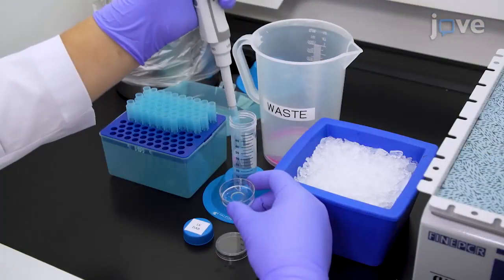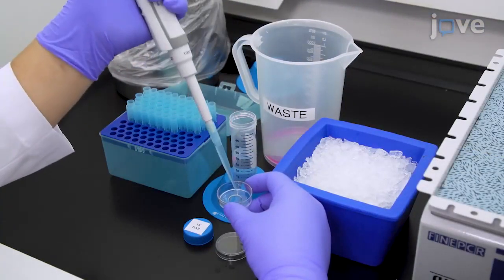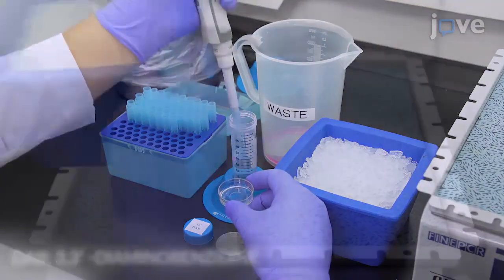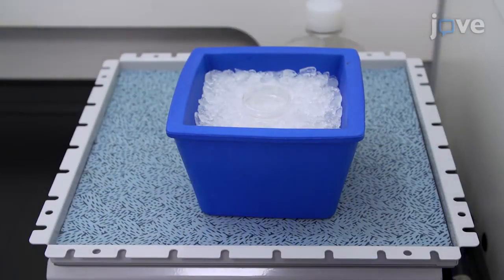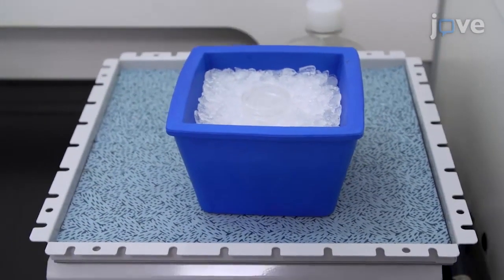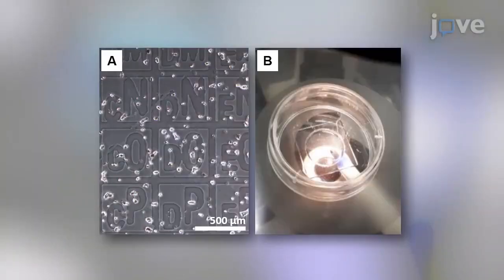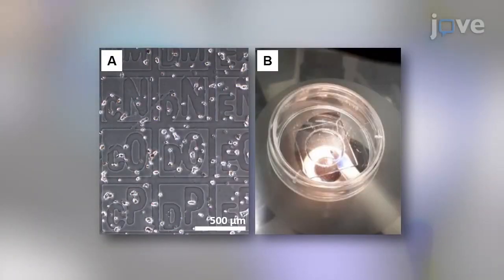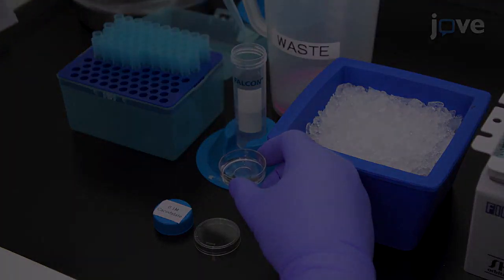Next, label the cells with 500 microliters of freshly prepared DAB solution and incubate the cells on ice for approximately 5 to 45 minutes. When a light brown stain is visible under an inverted light microscope, rinse the cells 3 times with 1 milliliter of fresh solution.